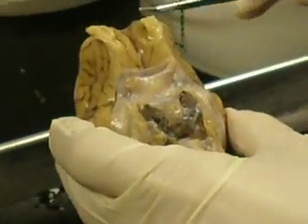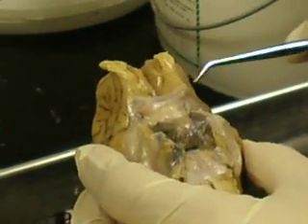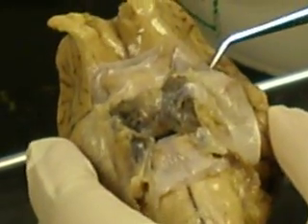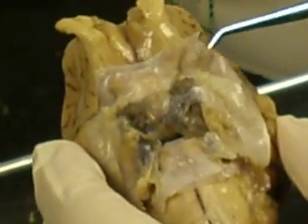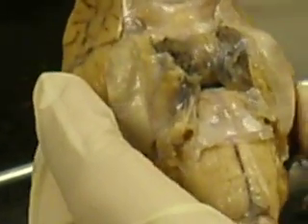Here you can see the olfactory nerve. You have your optic nerve. This covering is dura mater.